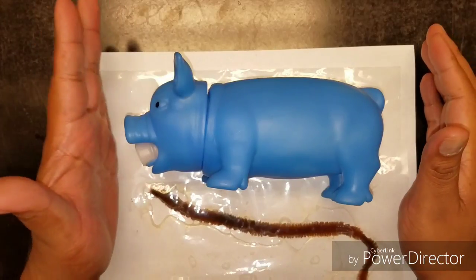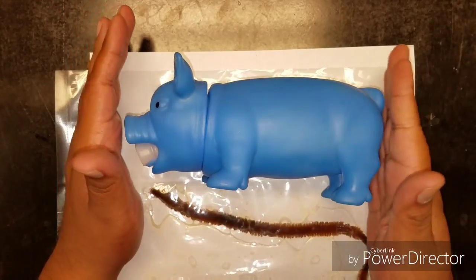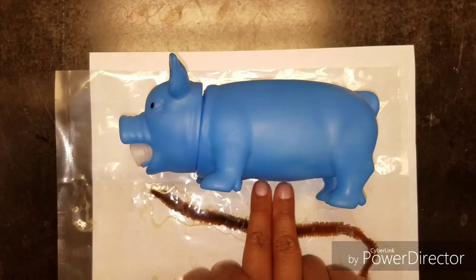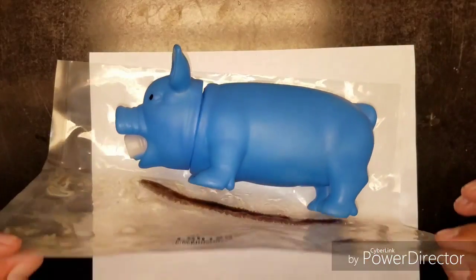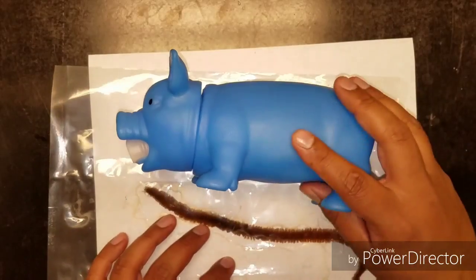If I'm talking about anterior, I'm talking about the head area. If I'm talking about posterior, I'm talking about the rear. If I mention ventral, I'm talking about the bottom or the belly side. And if I'm talking about dorsal, I'm talking about the top or the back side. For right now, I can't turn the worm sideways like this because you wouldn't see anything. It's really flat. So that's why I'm using my pig.